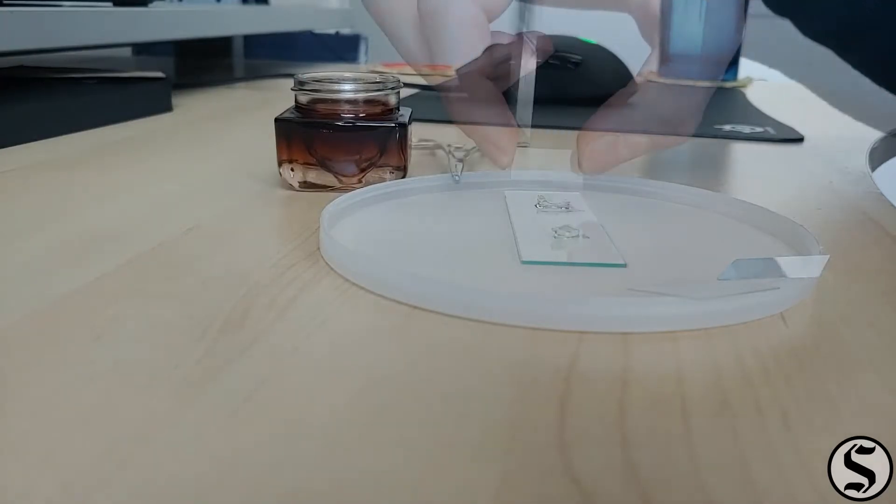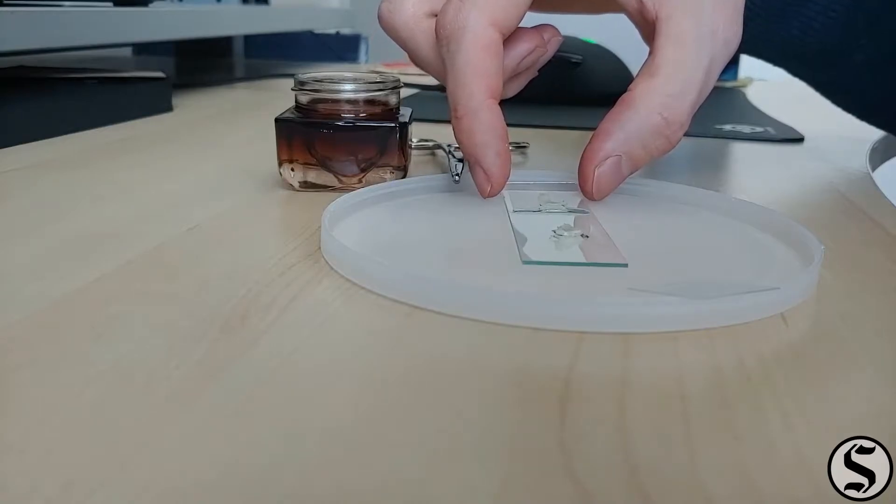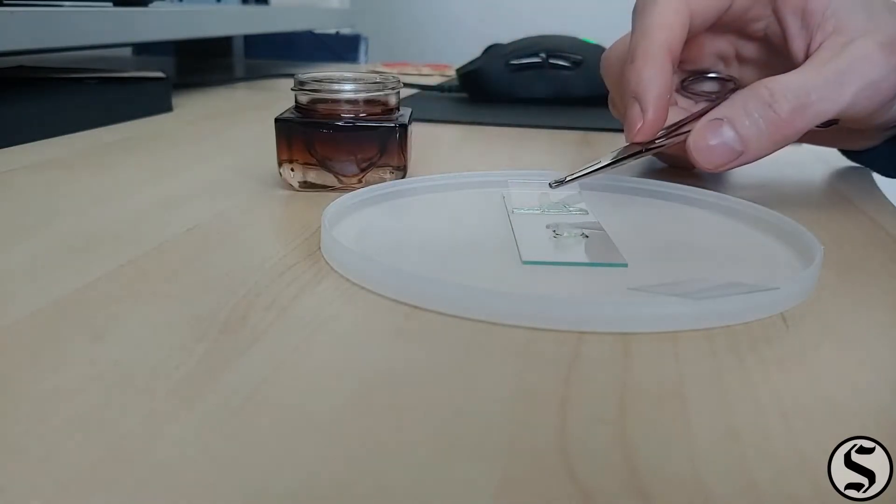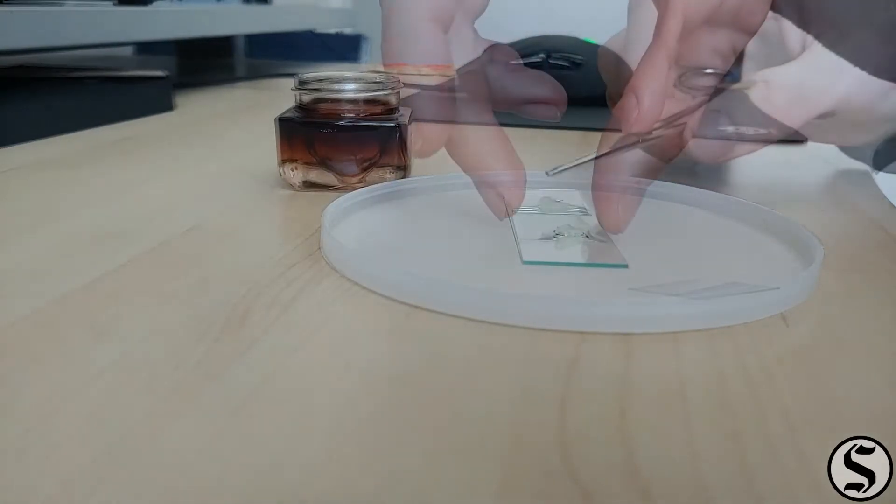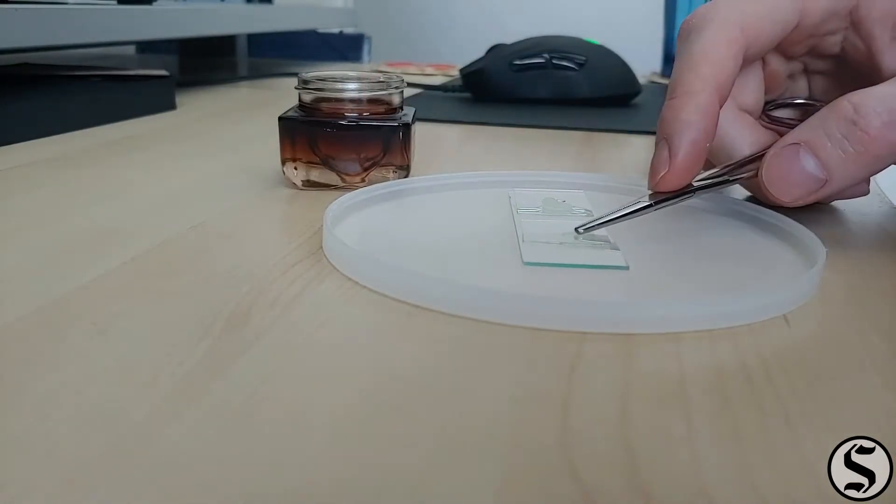I made sure there was water both under and over before I put on the cover slip and pressed the air out. And now we can investigate them.